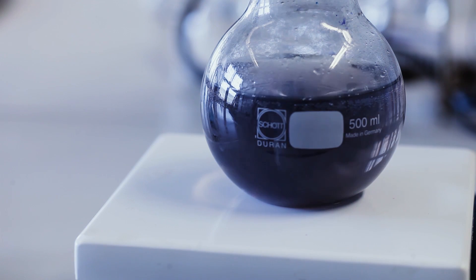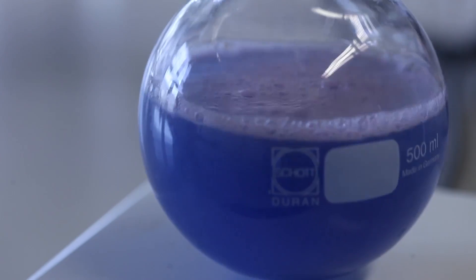You can watch the effect of decolorization immediately because glucose is reducing the dye to a colorless form.